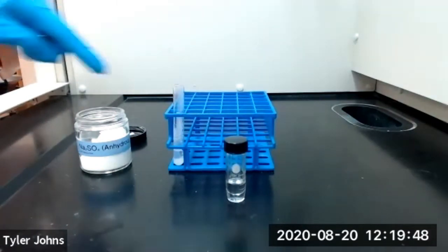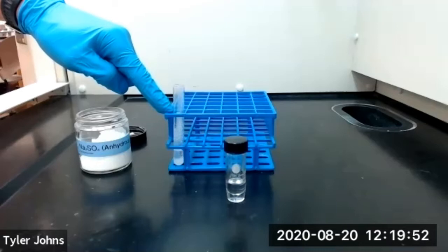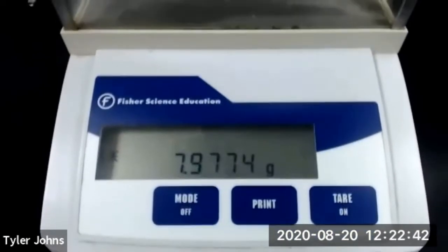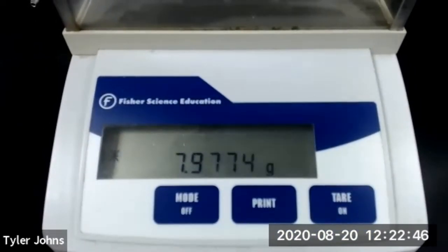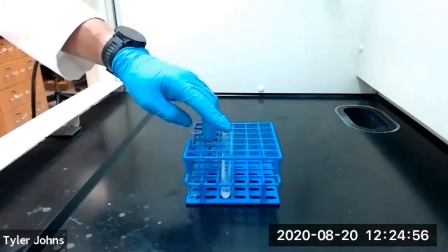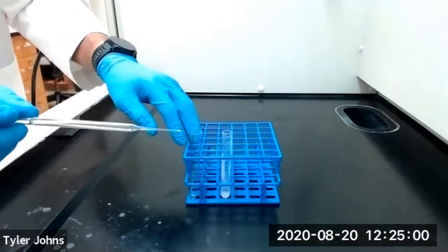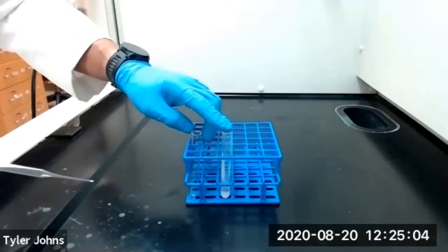While we allow our organic layer to continue to dry, we'll pre-weigh a test tube. The mass of our test tube is 7.9774 grams. We'll now transfer our dried methylene chloride solution to our pre-weighed test tube using a filter tip pipette. This will ensure that we leave the drying agent behind.